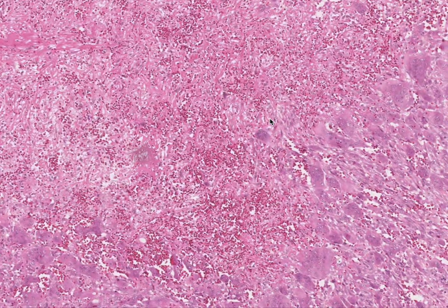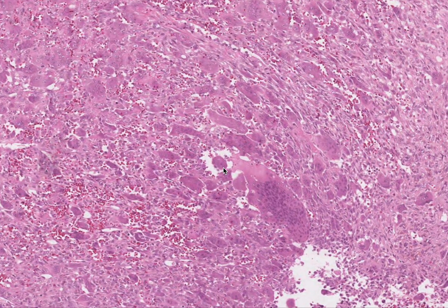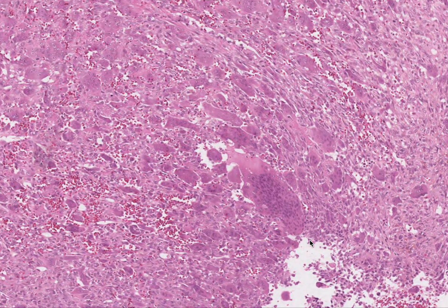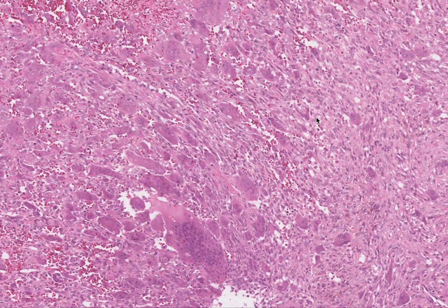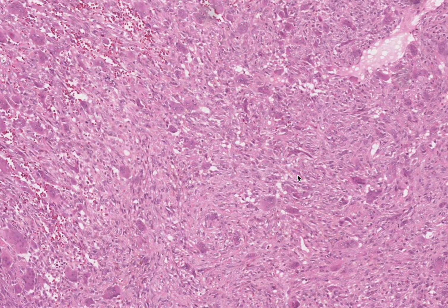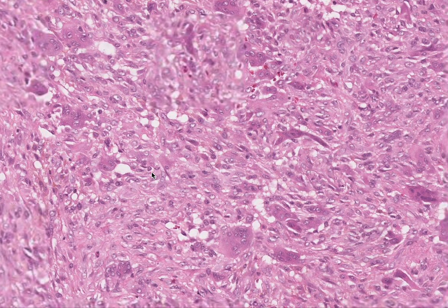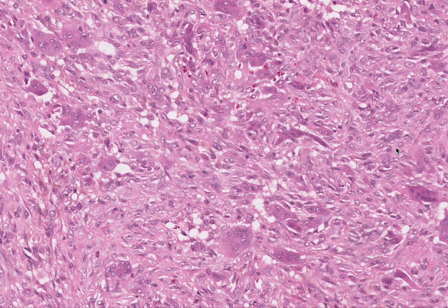If you look at the cellularity, you must have pointed out one thing — there's a very prominent number of giant cells. Look at this giant cell here; it's huge, at least 50 nuclei. So I have giant cells, I have areas of hemorrhage, and if you look at the corner of the tissue, you can see lots of single mononuclear cells which are spindled out as well.